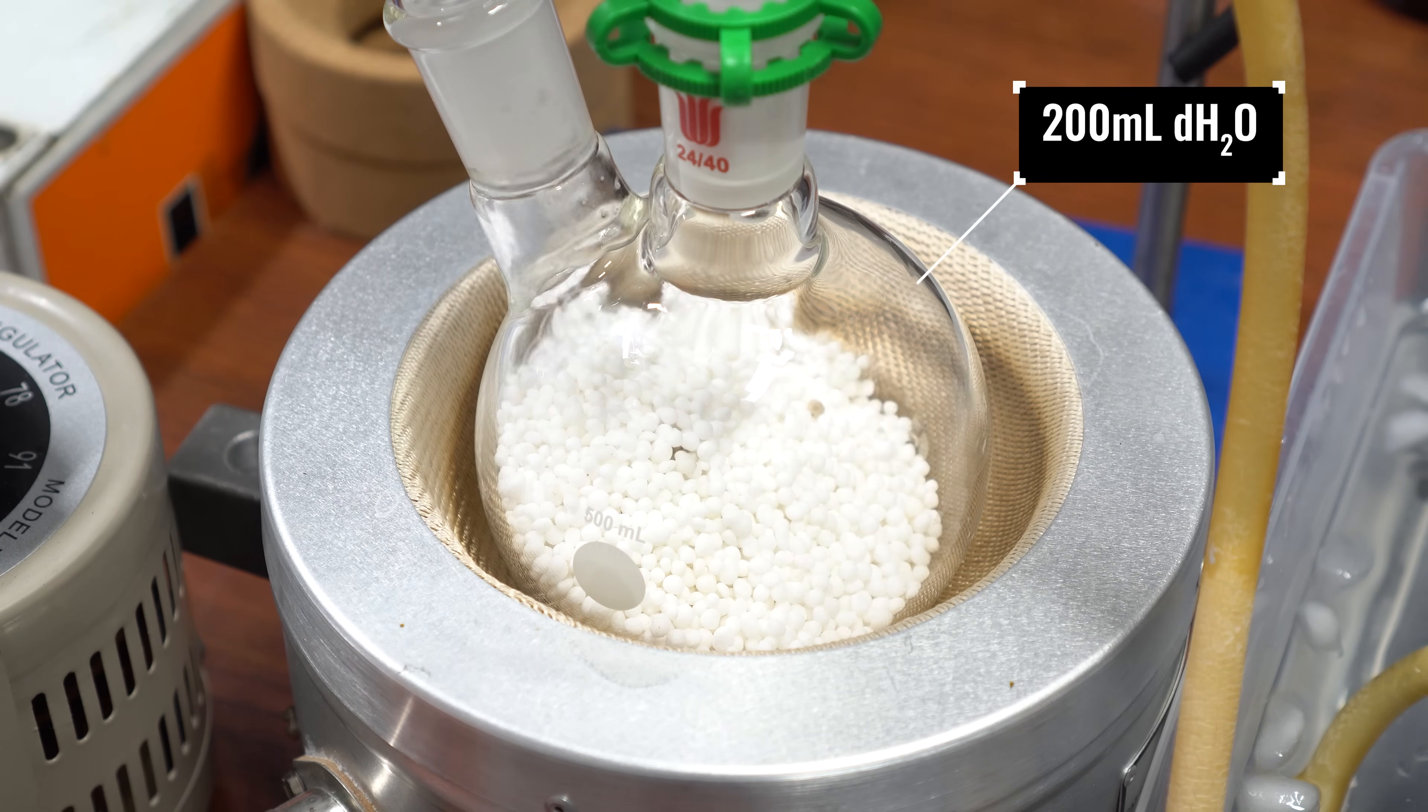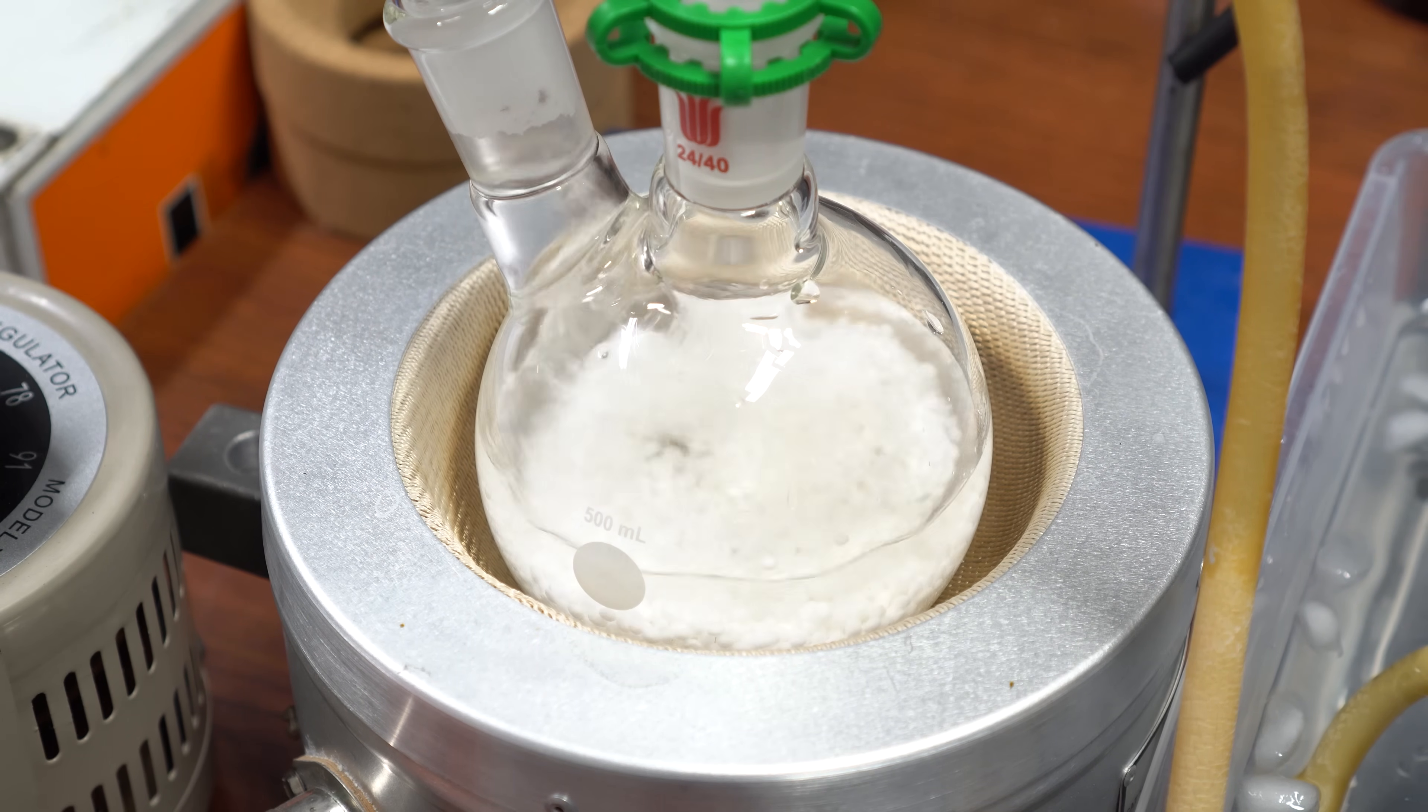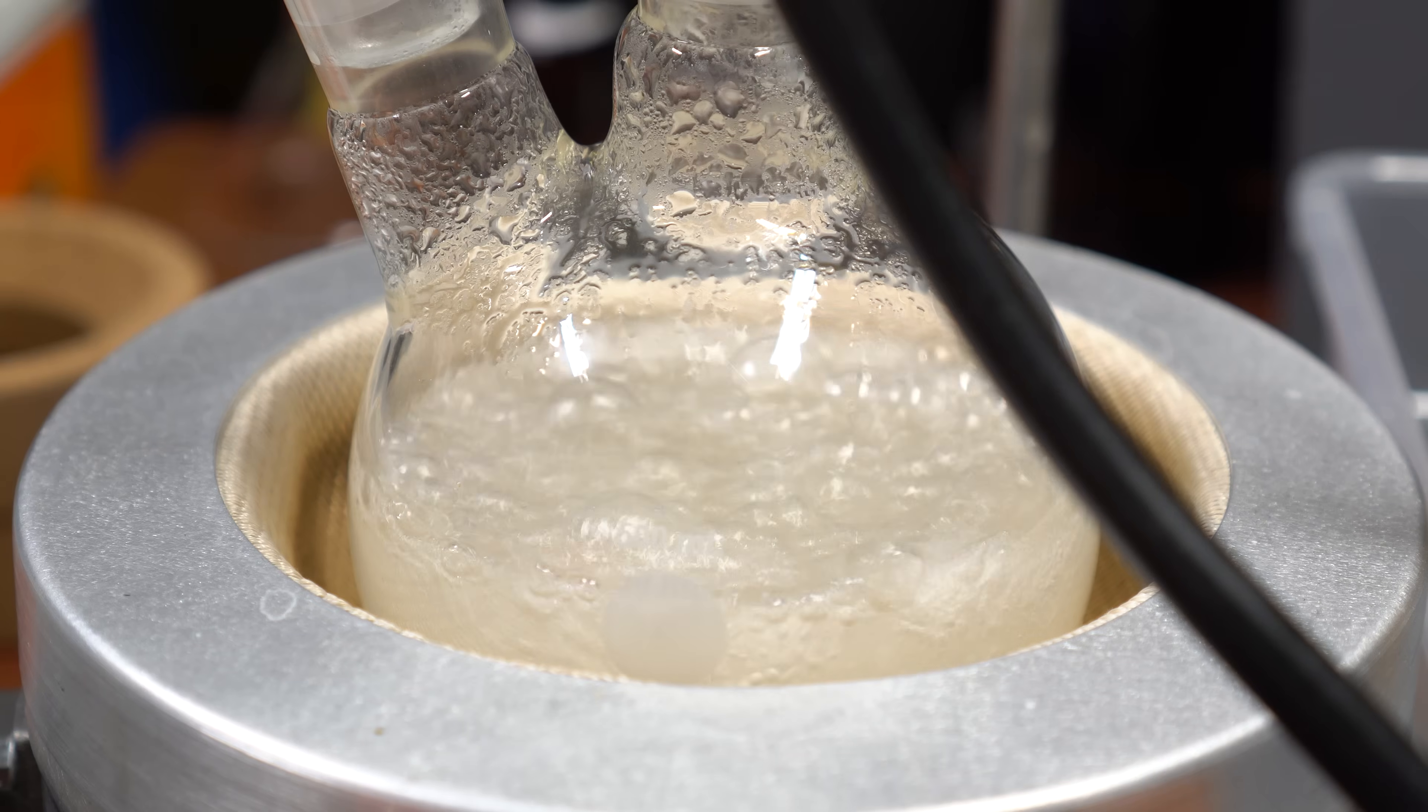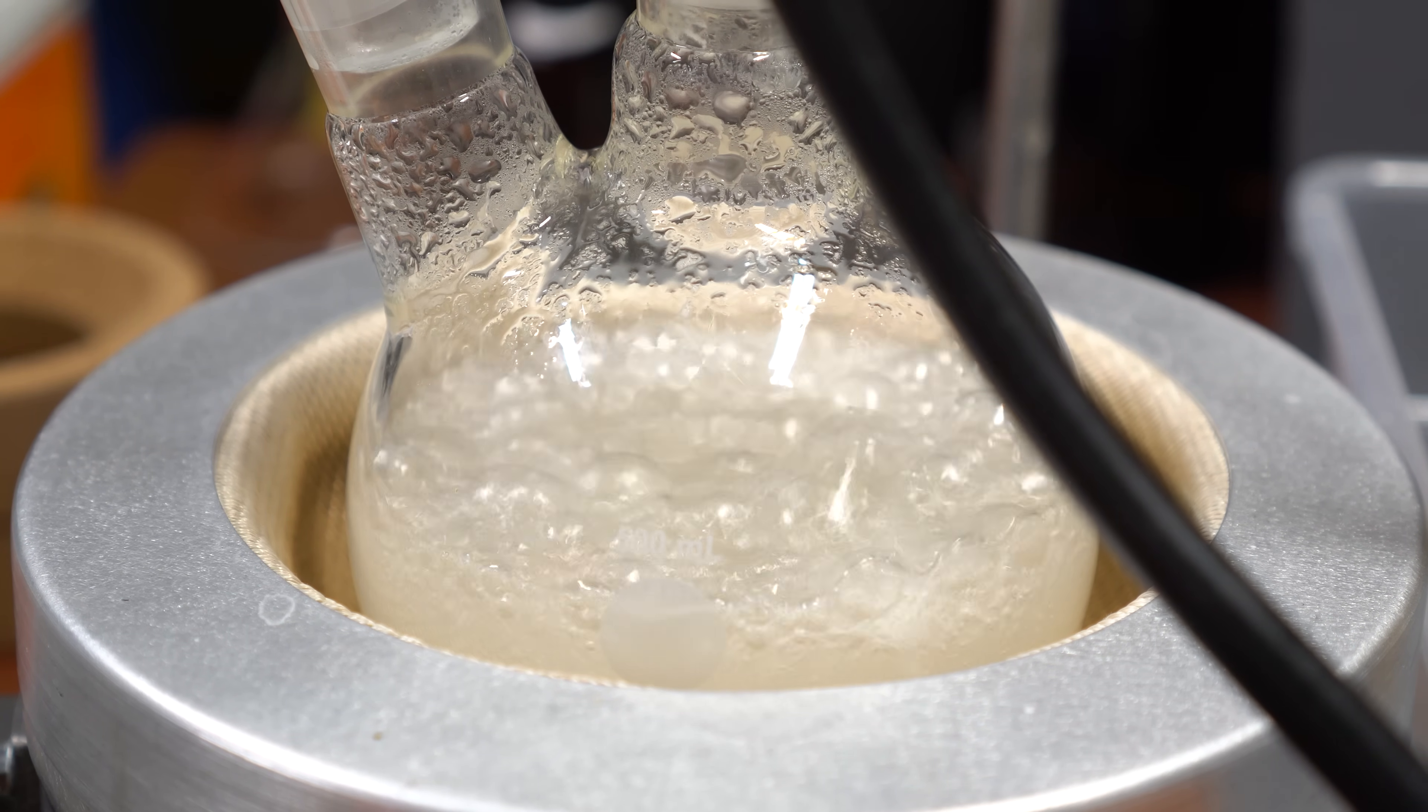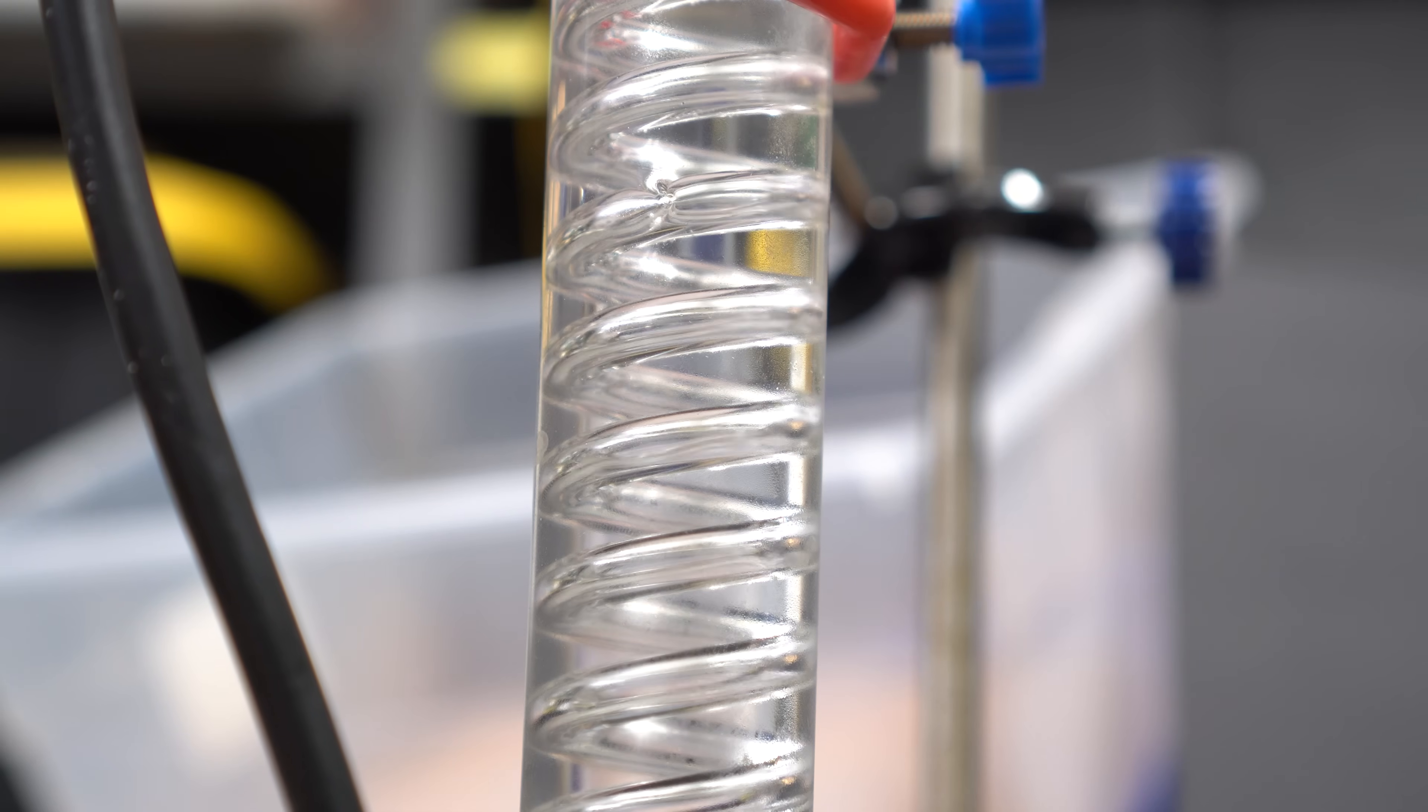With that, 200 milliliters of distilled water was added to the reaction flask. The funny thing about this heating mantle is it doesn't stir, so I just used the stir bar as an anti-bump protocol. Once the water was added, I cranked up the heat and we have a boil going. The sodium hydroxide and urea is reacting and creating ammonia gas.